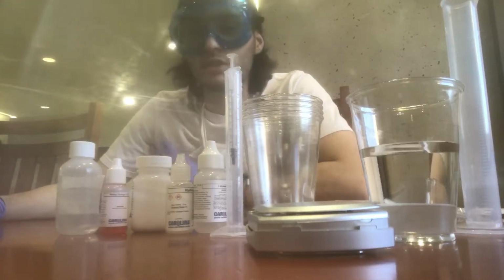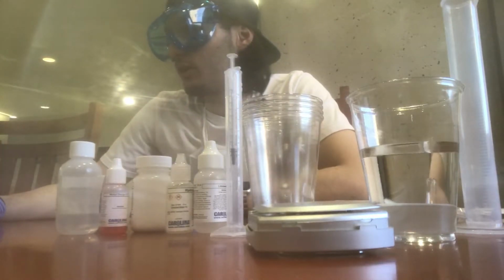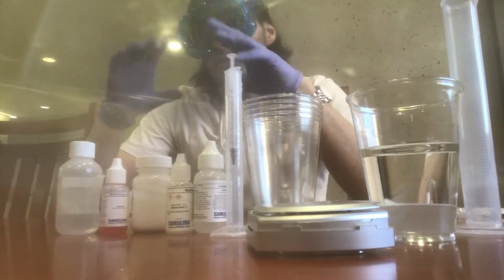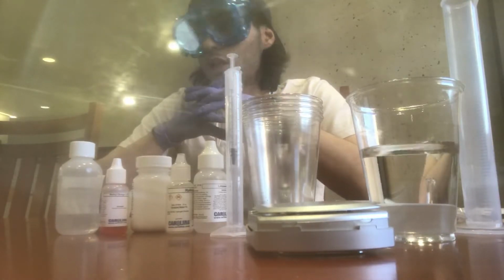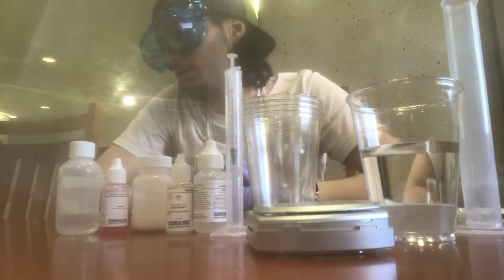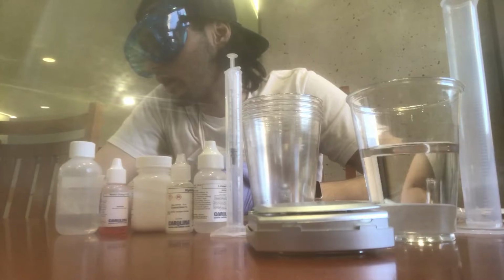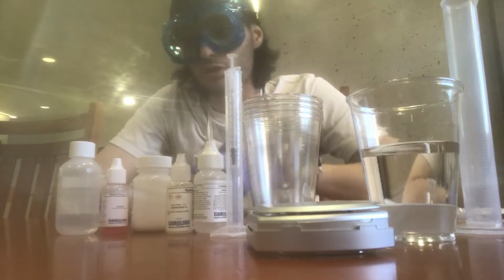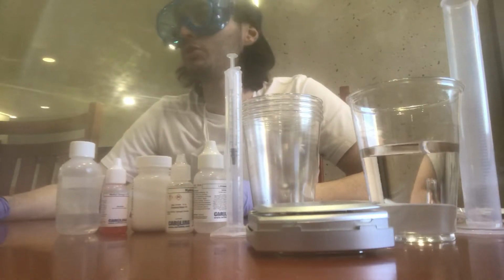The equivalence point, I've talked about this in previous lab videos, is the point in a titration at which the moles of acid are exactly equal to the moles of base in the solution. When they're both equal, that's when you have an equivalence point. There's also something called the endpoint, which is the experimental estimate of the equivalence point. In this investigation, the endpoint is identified by a color change in the indicator solution, methyl orange. It looks like a very interesting experiment, so let's go ahead and jump into it.